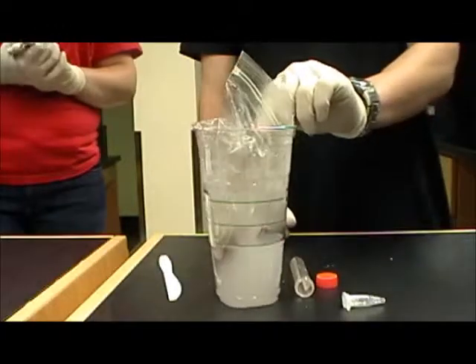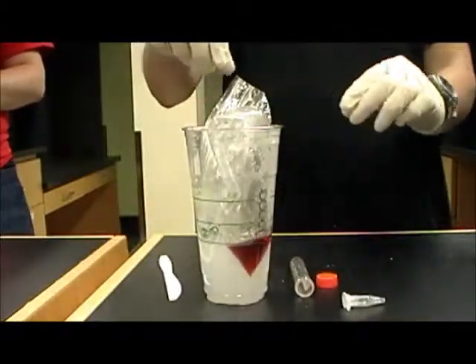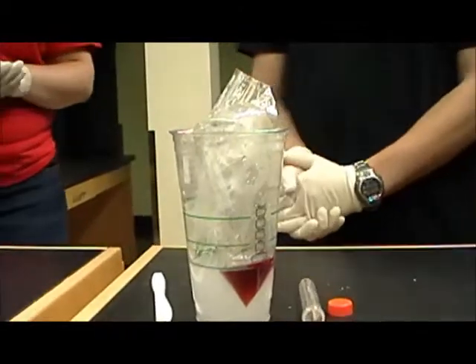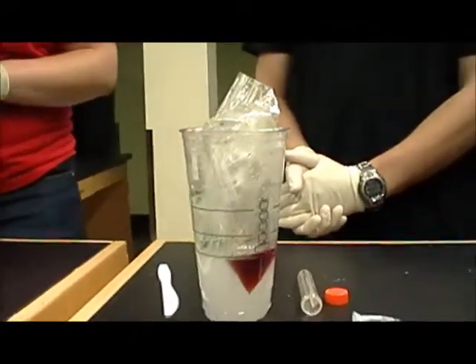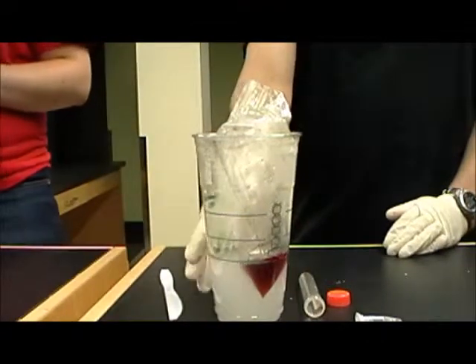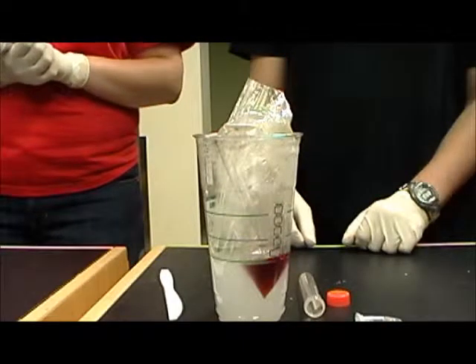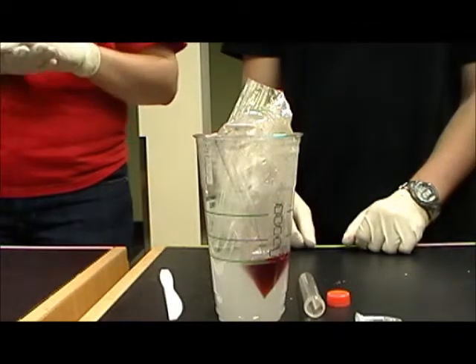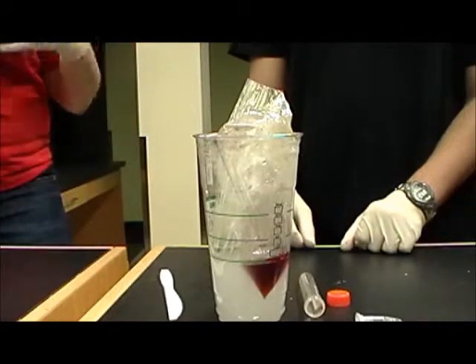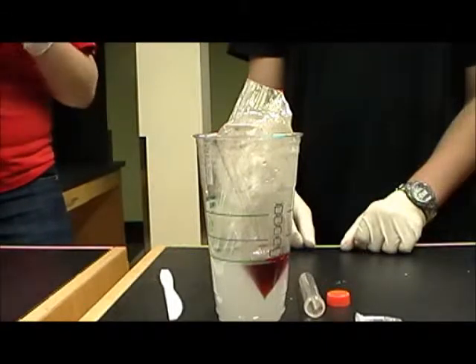And then eventually the iodine will start moving out of the bag. This will take a little bit of time. It doesn't happen instantaneously. And while the students are waiting for this to happen, they can periodically jostle the cup a little bit. And while they're waiting on that to happen, we provided a few questions within the handout. One of them actually addresses the fact that this takes a little bit of time and what some of the factors might be that make it go slower or faster for different groups.